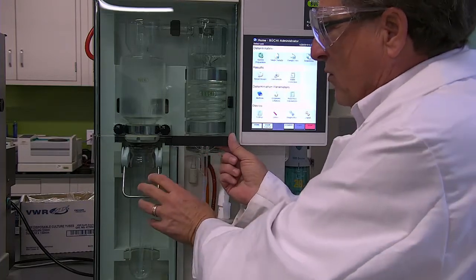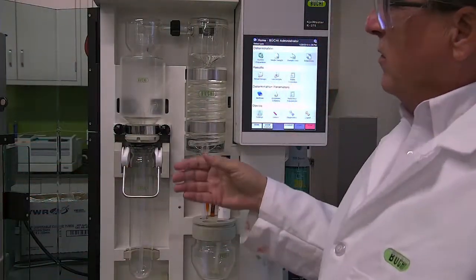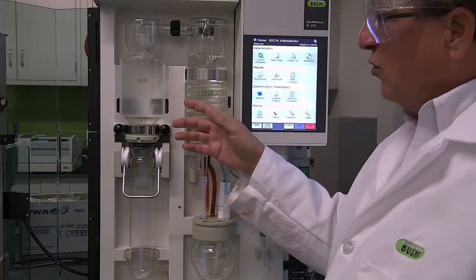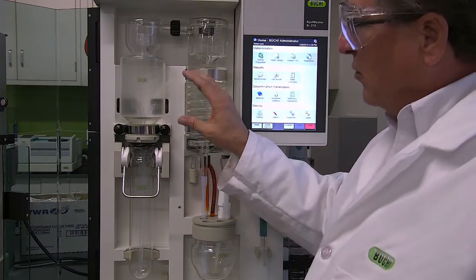We have our safety shields that we're going to open. That gives us access to two very important parts and two very important seals on the instrument.